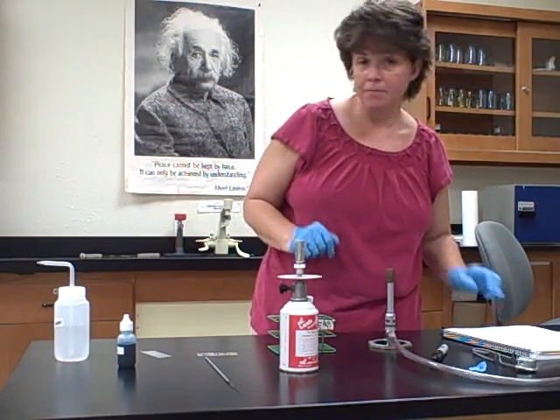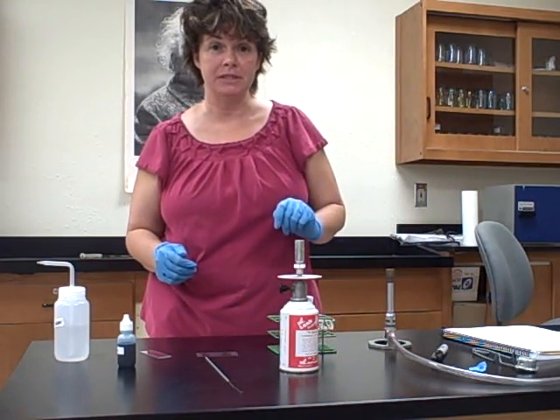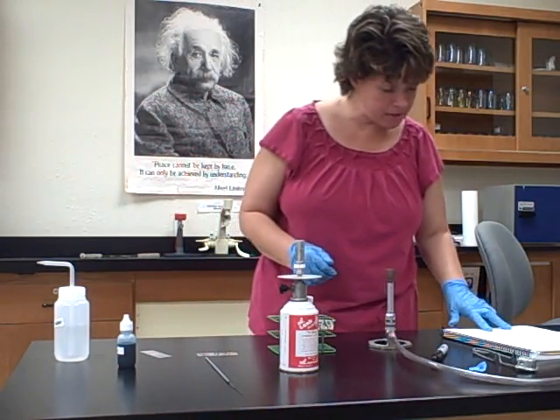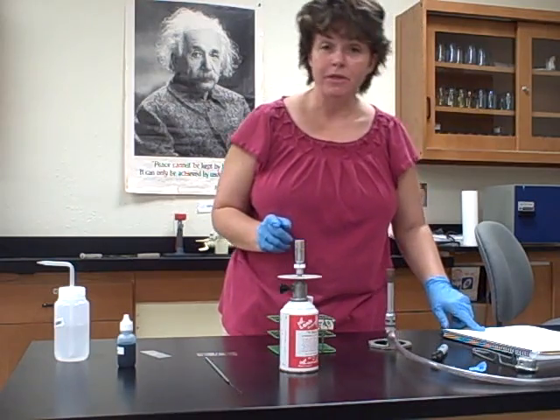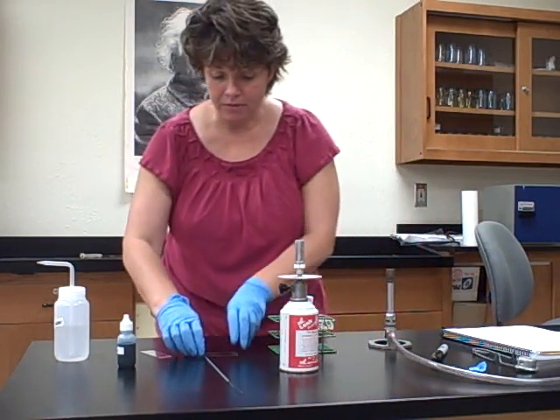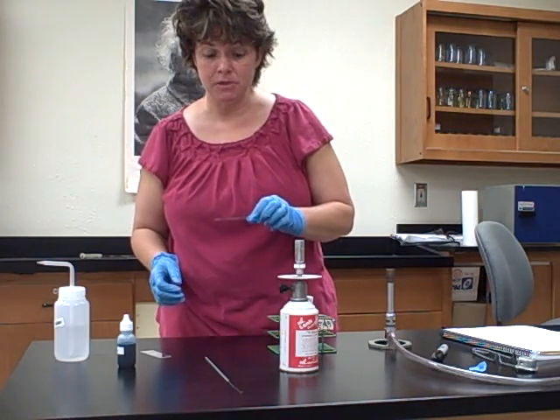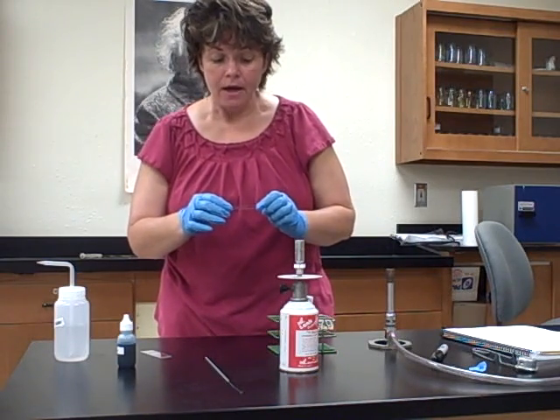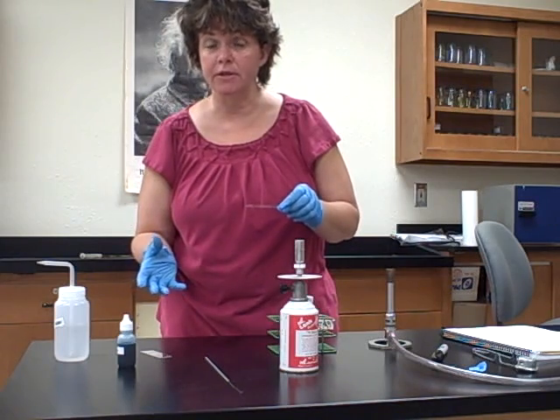Now that they've dried, I'm going to fix it to the slide — meaning make the bacteria stick and kill any bacteria on there. You want the bacteria dead and stuck to the slide but without destroying their cell walls. There are two possibilities in your book: G procedure and H. We will always do G, so cross out H because we're not going to use the methyl alcohol. We're always going to use the flame for fixing — always heat fix. After the slides are dry, pretending the flame is going and wearing goggles, run the slide through the flame a couple of times on each side. A clothespin might come in handy if you're worried about burning yourself. Don't hold it on the flame — just run it through a couple of times, otherwise you'd be lysing the bacteria and distorting their cell walls.